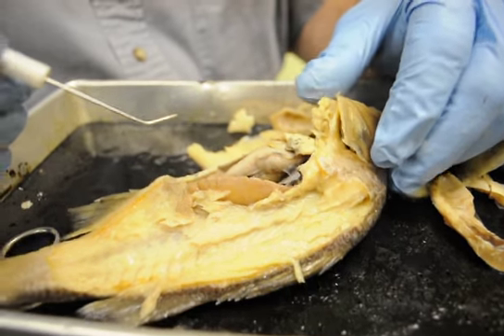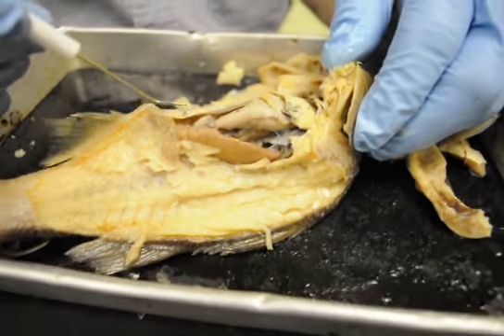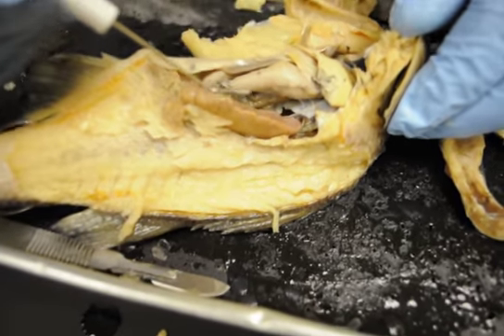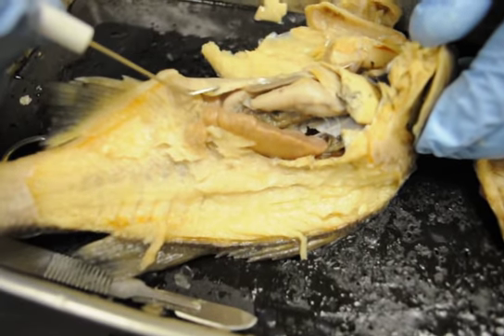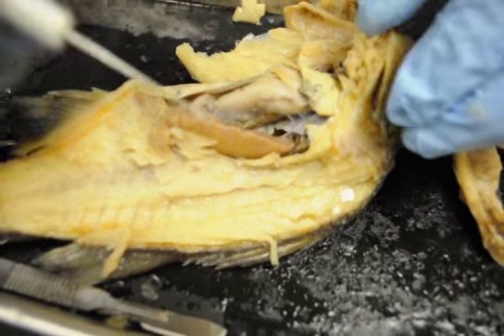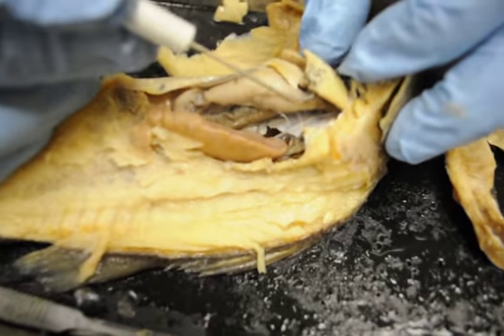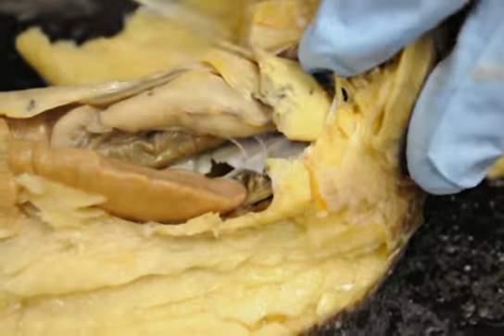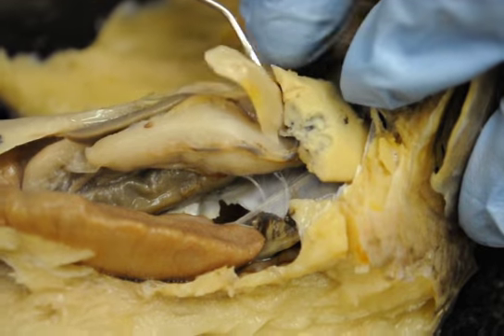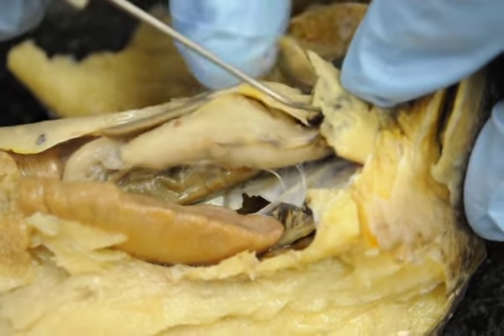Now we've cut away all the external muscle and skin tissue from the body cavity, from the visceral cavity, and I've exposed all the digestive glands as well as the heart. Let's start with the digestive gland. The first thing we see here, which is partly torn away, is the liver. You can see that structure here, and in cutting it away, part of this right here was damaged. So that's the liver, and the gallbladder hanging underneath it here. This is the liver and gallbladder here.